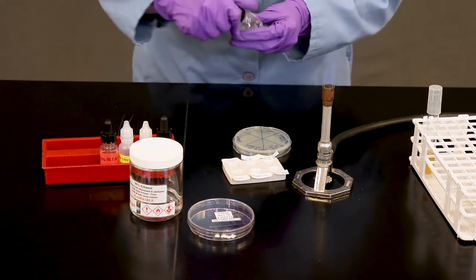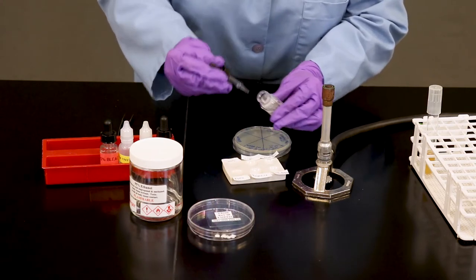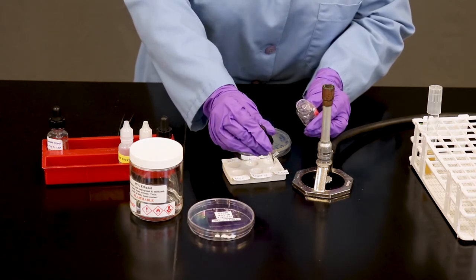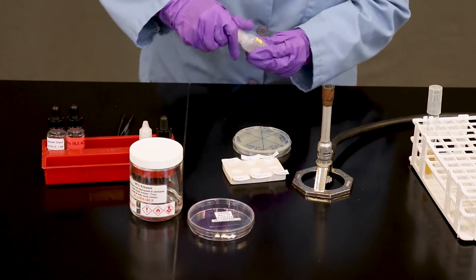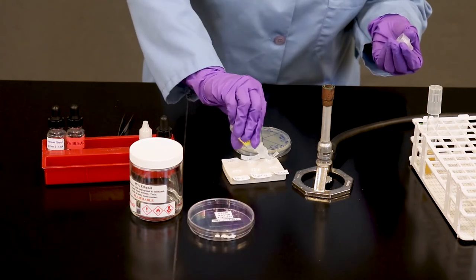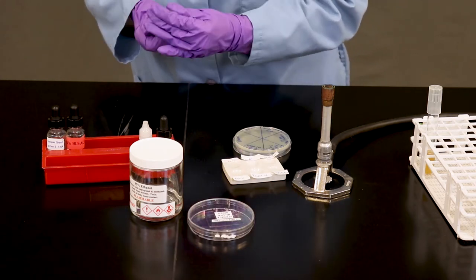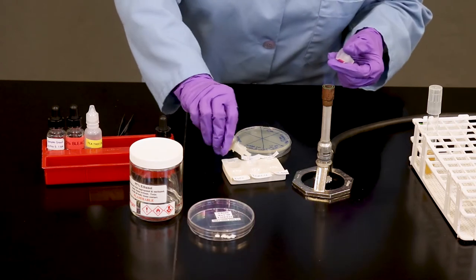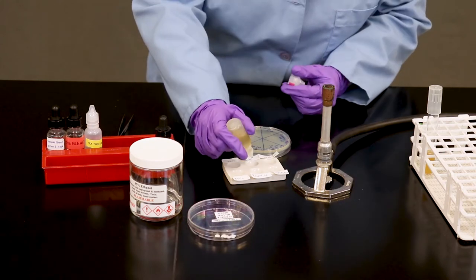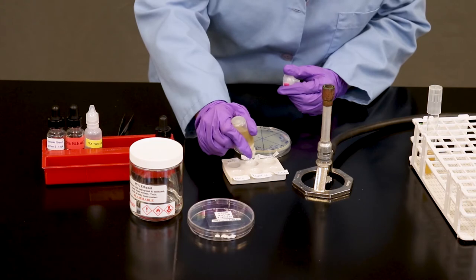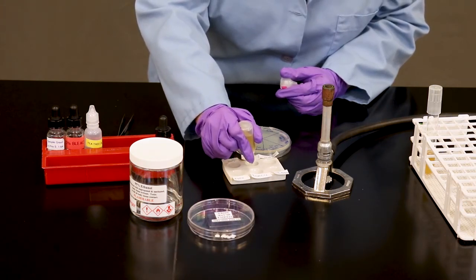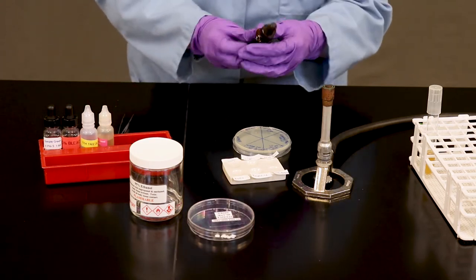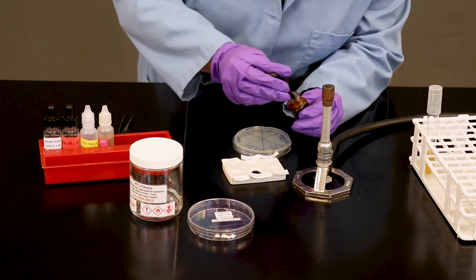The grapefruit seed extract is very viscous, so it's a little bit difficult to dispense. It should be plenty. You want to do your best not to cross-contaminate your wells.